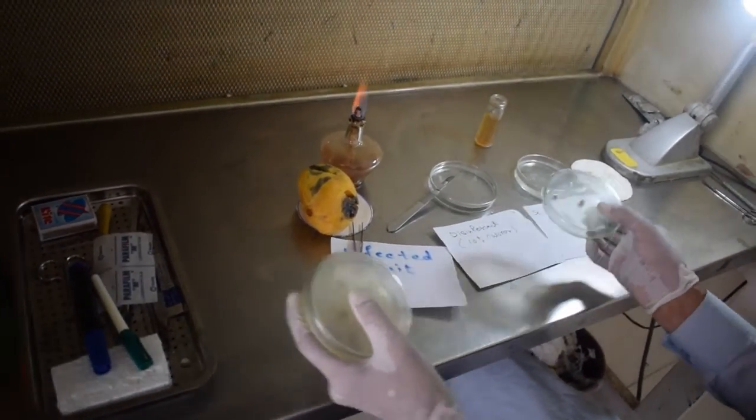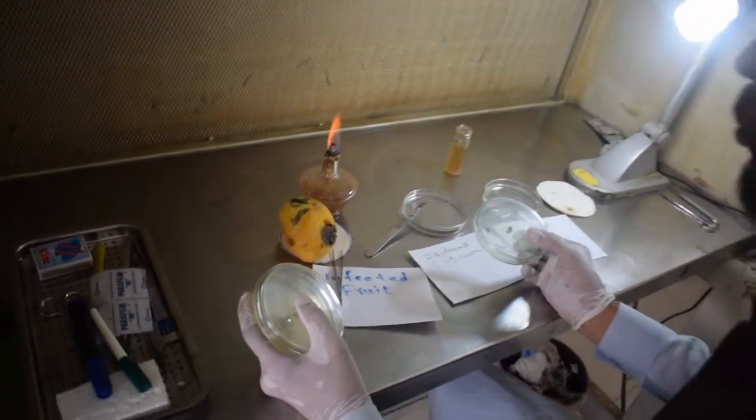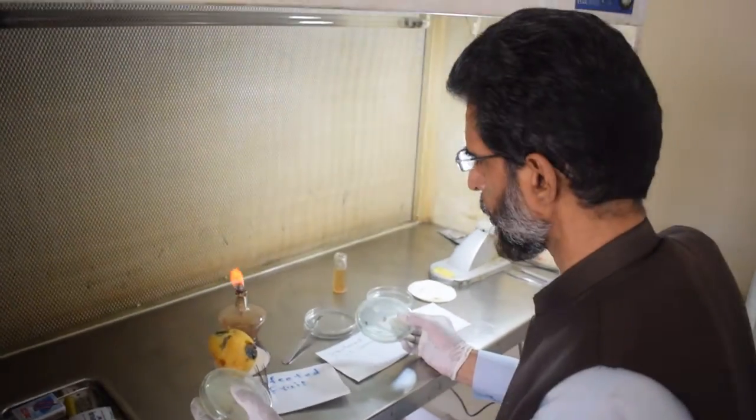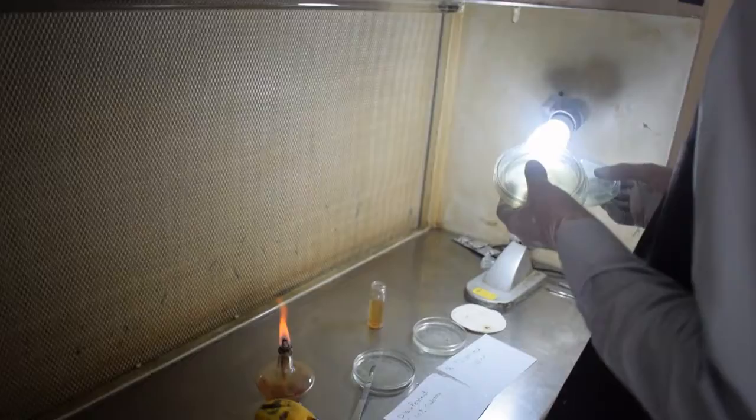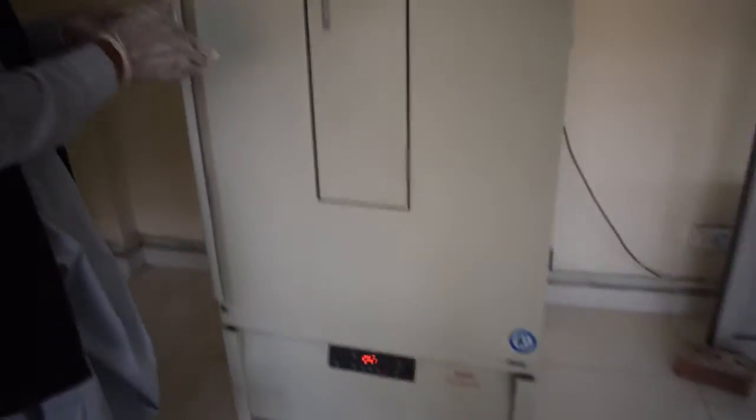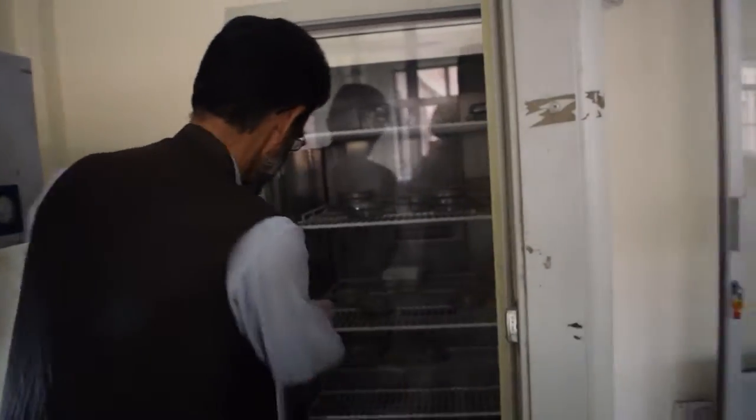This is the whole isolation process in aseptic condition in the laminar flow. Thank you very much for today's demonstration. The last step is we are keeping it in the incubator. It is placed at 25 degrees centigrade.